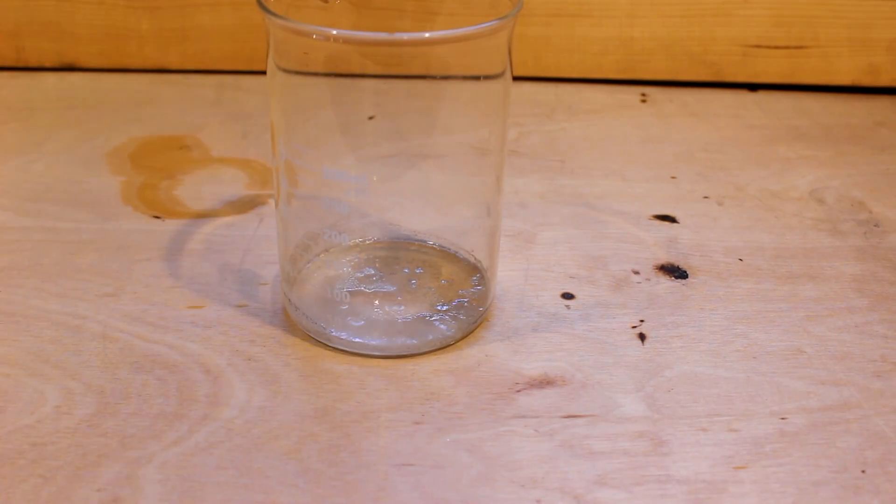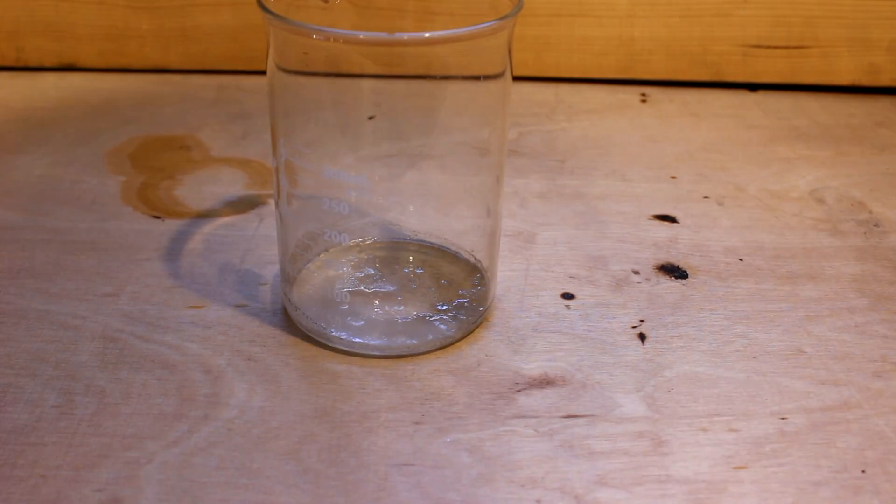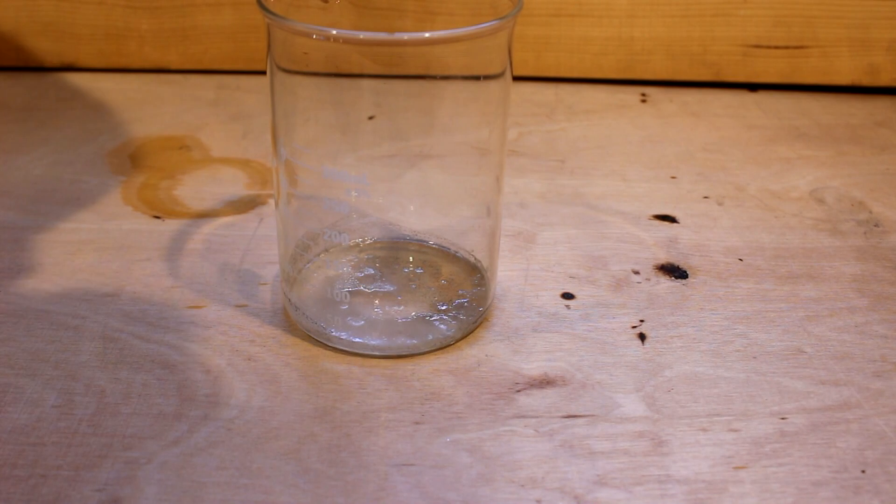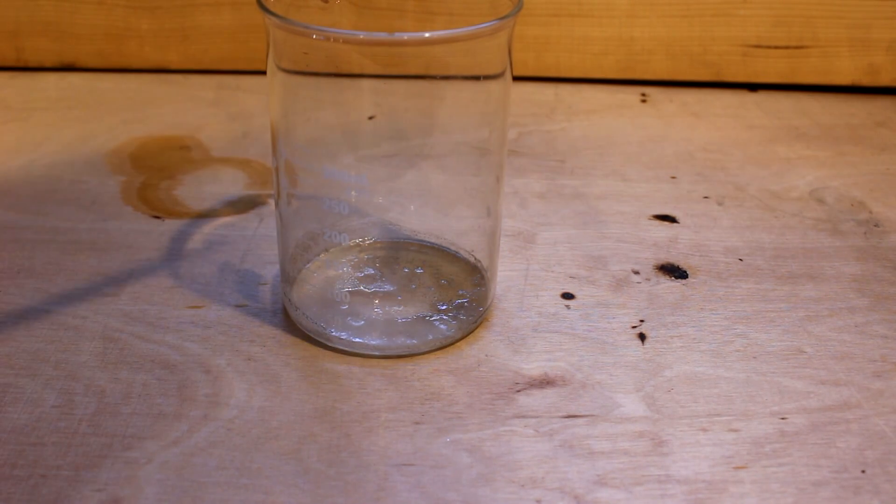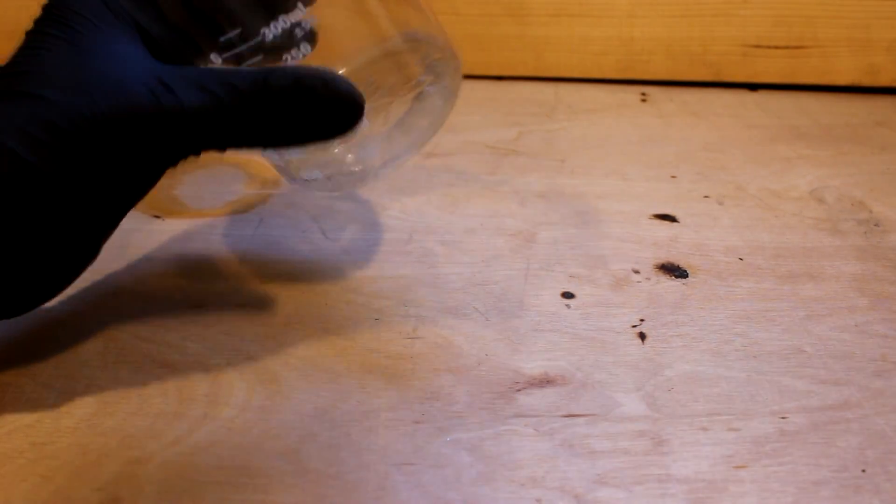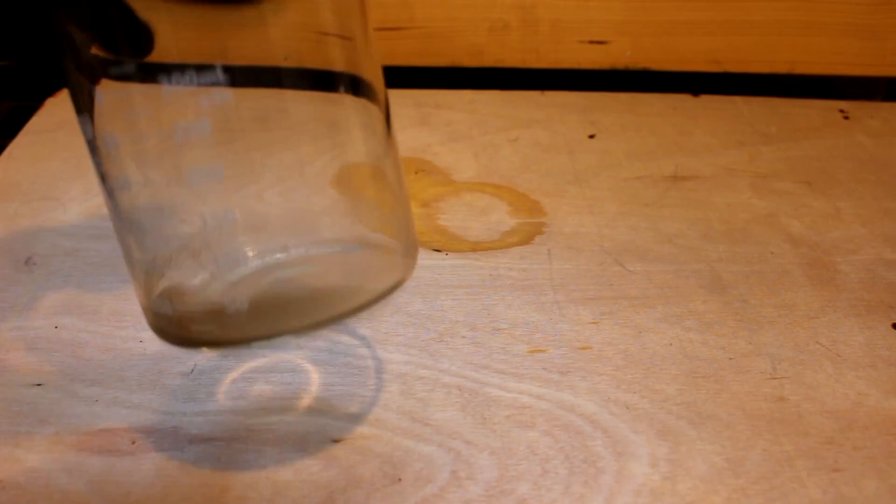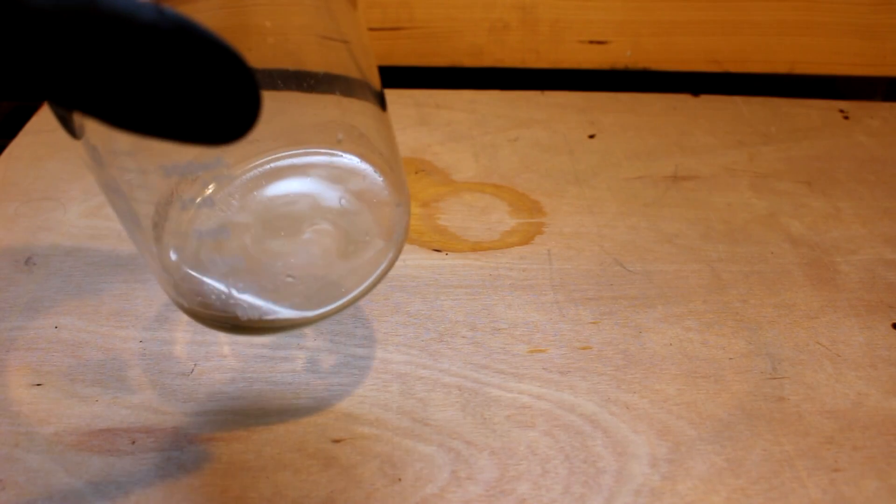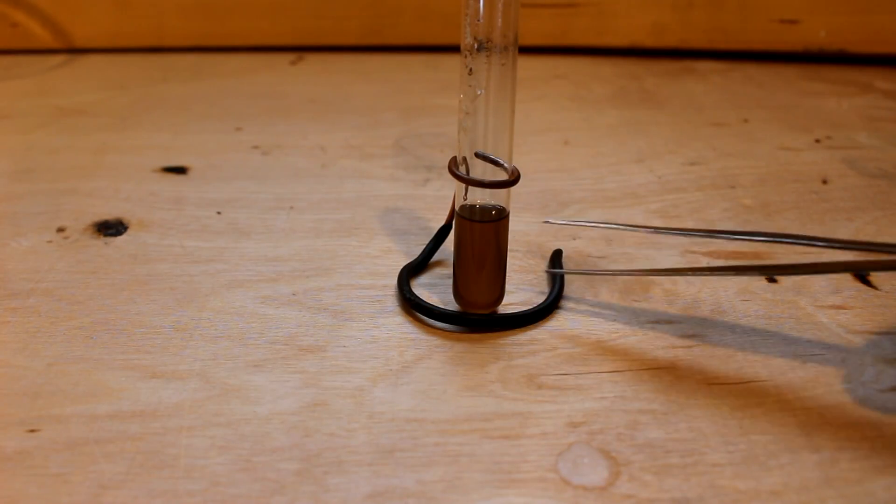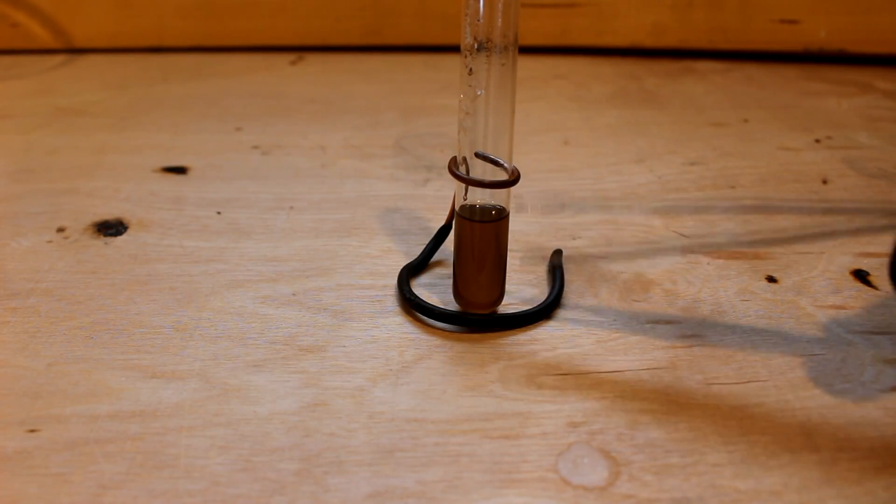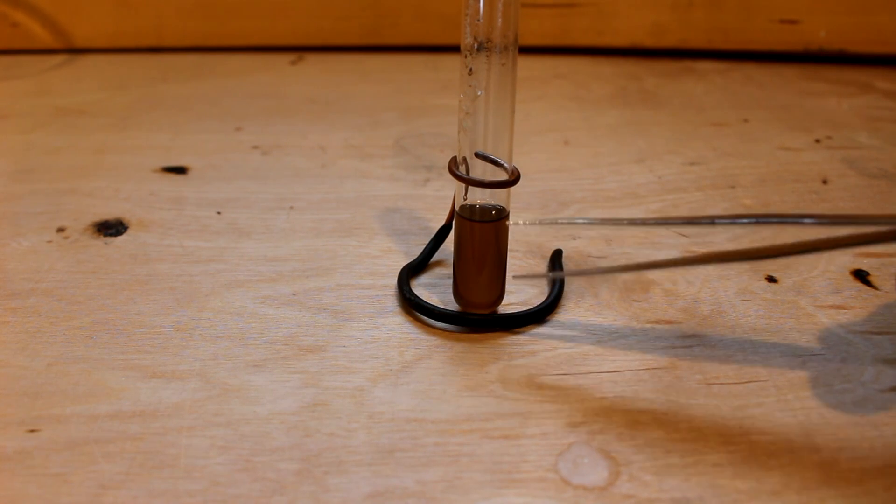So now I'm going to add a little bit of water back. Pretty much drop-wise just enough to get it to the point where it's mobile again. So a couple of drops and let it dissolve. There we go. I believe I got it mobilized. That's definitely a liquid. It's amazing when you think about how that piece of thallium metal is actually right here in the solution.